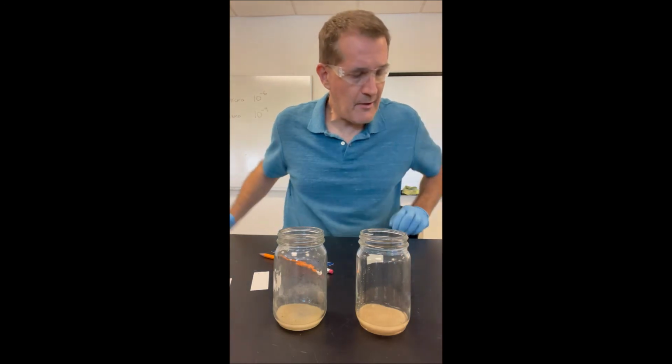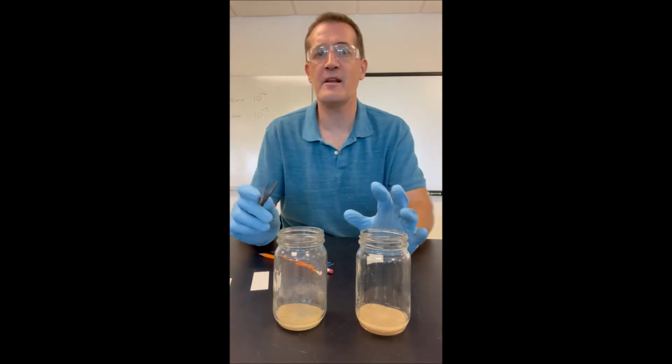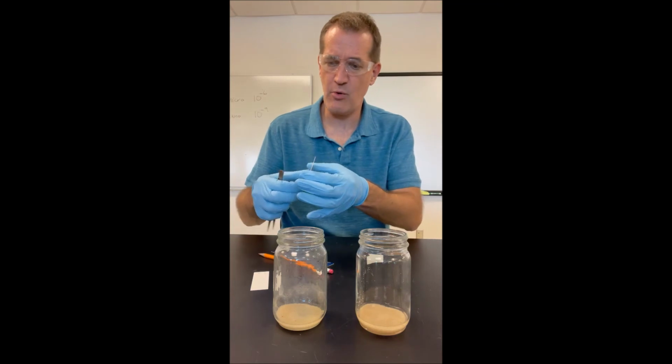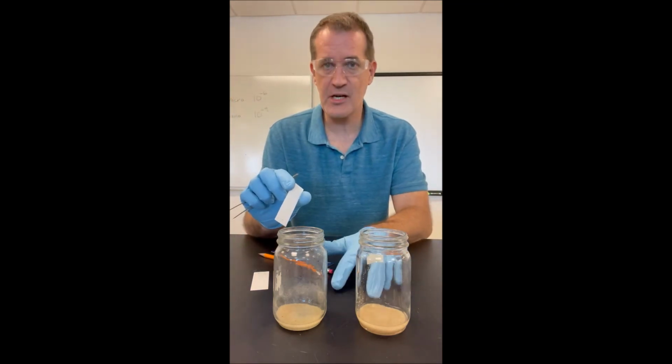All right, guys, now I have my 2 TLC plates prepared. I prepared them both in exactly the way that I showed you in the previous video. And now I'm going to take each of my 2 plates, as I drop one, I'm going to take each of my 2 plates and put them into a TLC chamber.